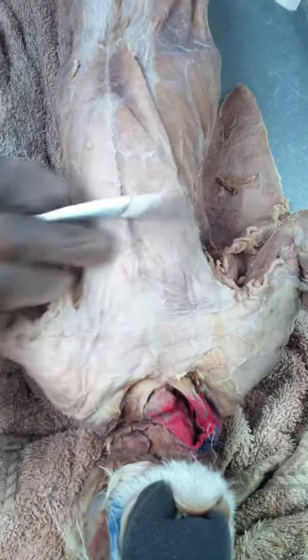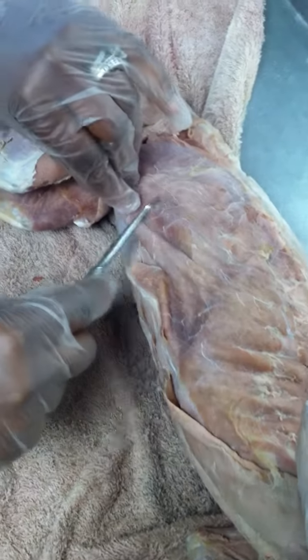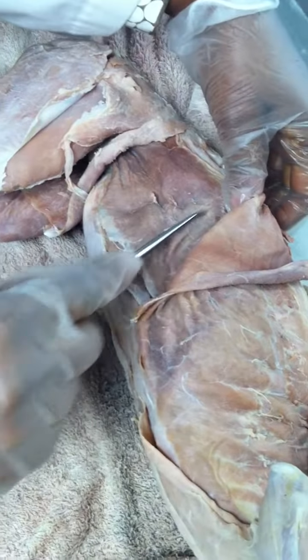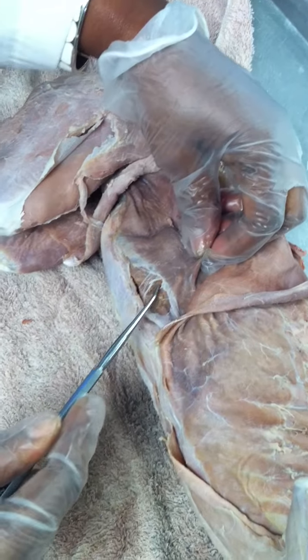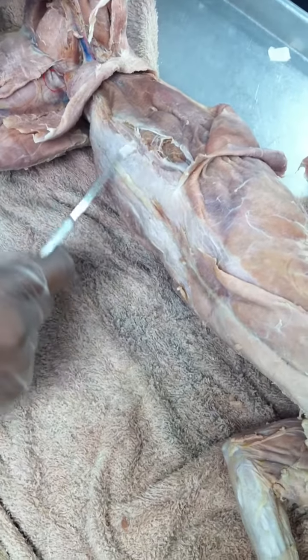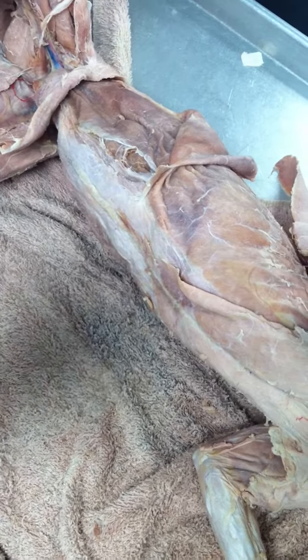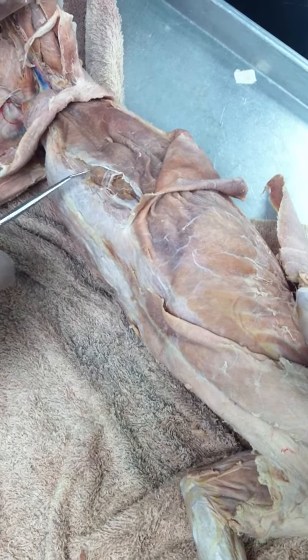Okay. Abdominal muscles. The most superficial is your external abdominal oblique. Underneath that is your internal abdominal oblique, and below that is another muscle, this one here that extends beyond the edge of the internal abdominal oblique, that is your transverse abdominis. And then running up and down the middle of the abdomen, that's your rectus abdominis, and you can see the edge of it here.